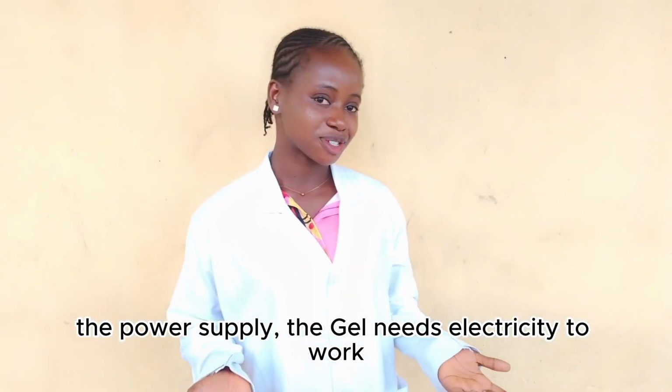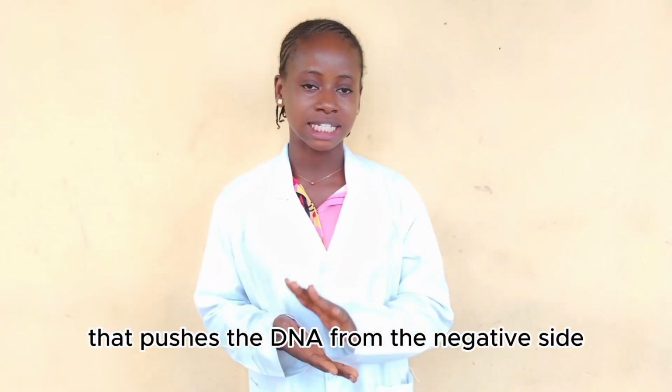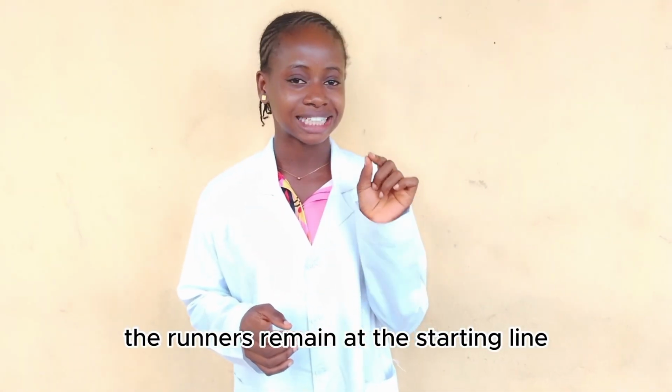The power supply. The gel needs electricity to work. This provides the current that pushes the DNA from the negative side to the positive side. Without this, the runners remain at the starting line.